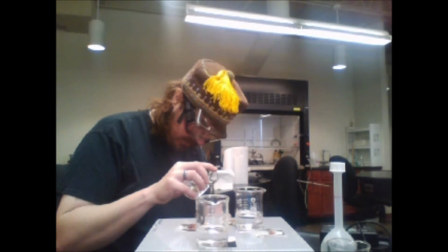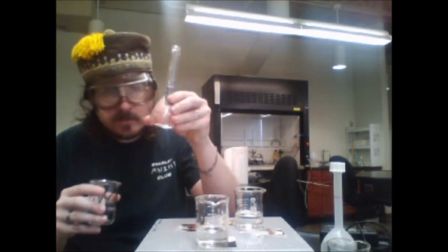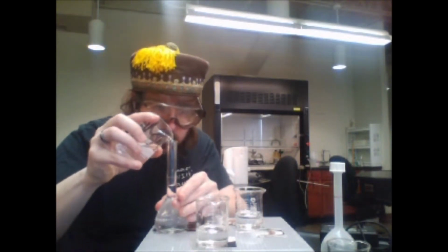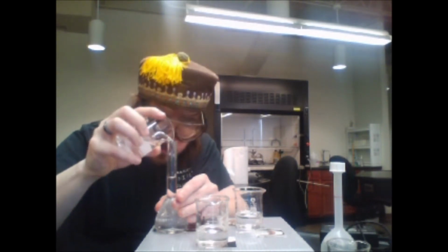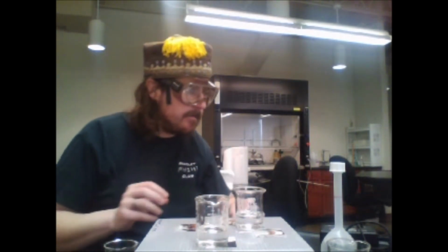I'm trying to concentrate. I've slowed down, it is not quite there. We're almost there. Carefully. Oh, that's pretty darn good.